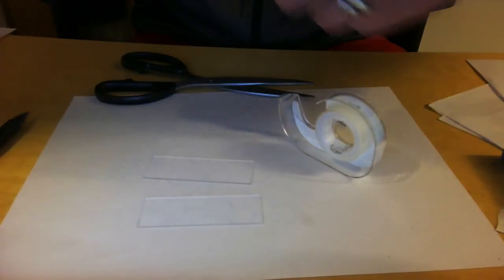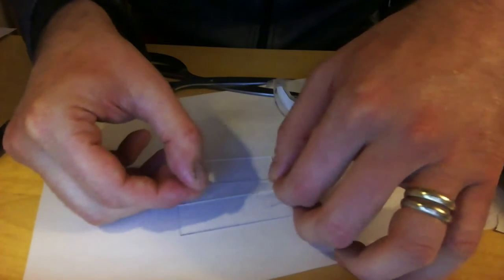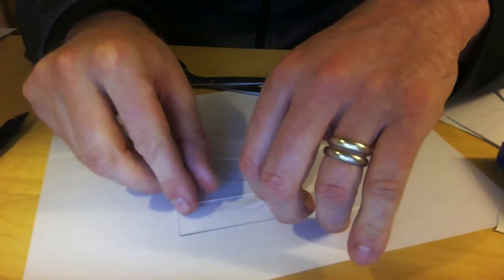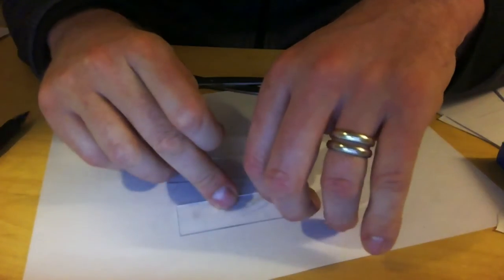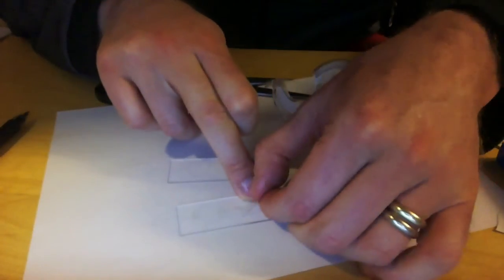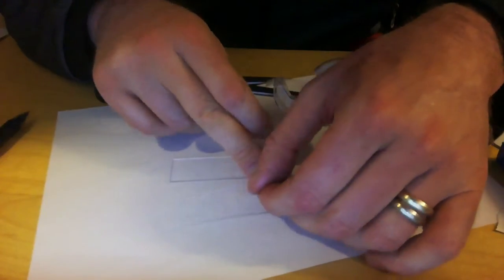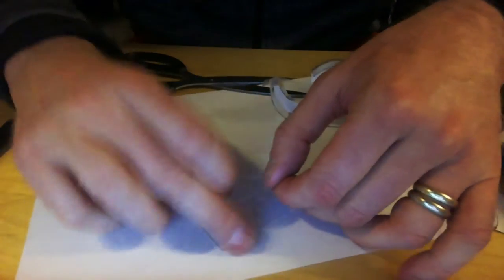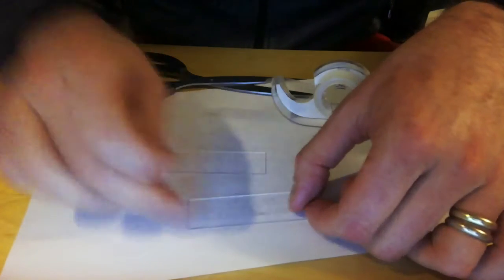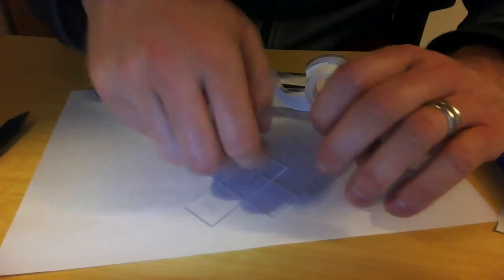Now I'm going to glue this part on a piece of glass. It all sticks together like hell already, which I don't necessarily want, but, well, that goes a bit wrong. So, this one goes here, and this one goes a little to the side here. So, now I'm going to put this glass on top.